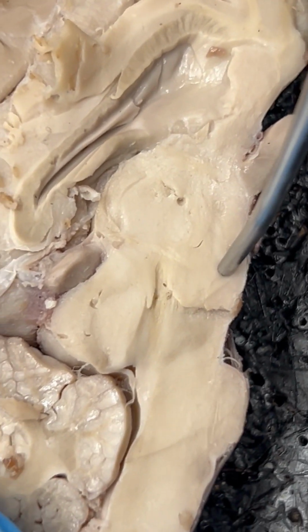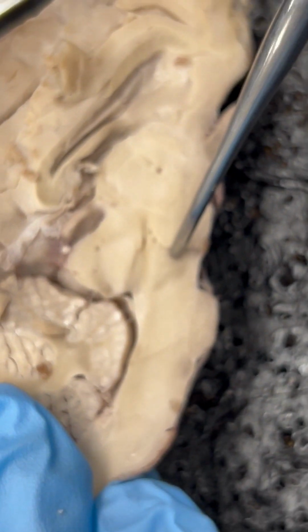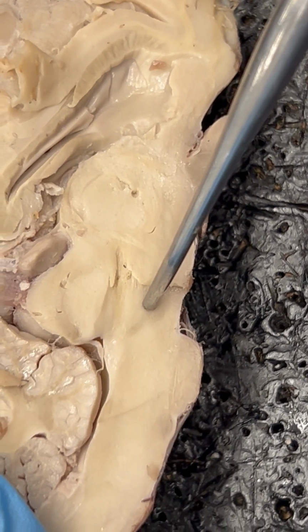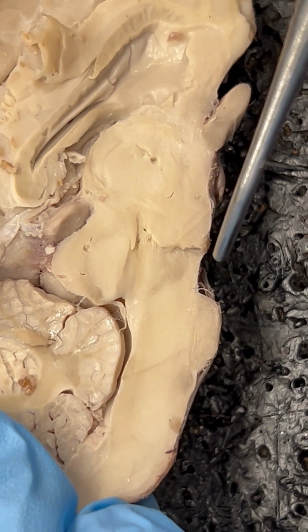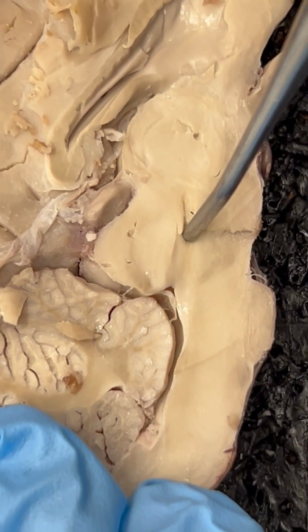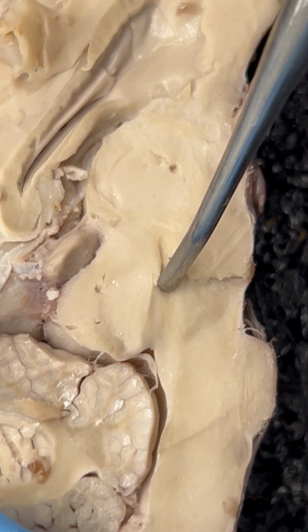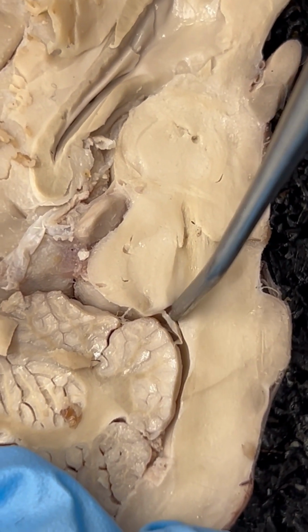Next, we move on to 23, which is our tegmentum. This is also known as the cerebral peduncles, and this is coming after our mammillary body. Number 24, we have our lamina quadrigemina, which lies underneath the superior colliculus. So we have the superior colliculus and the lamina quadrigemina. Number 25, we have our aqueduct, which you can see is a little bit of an indentation.